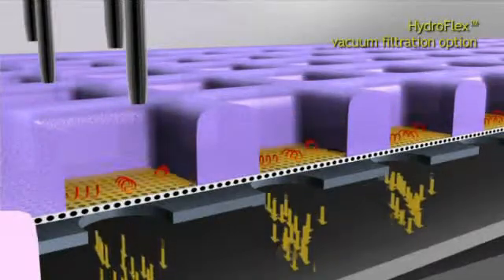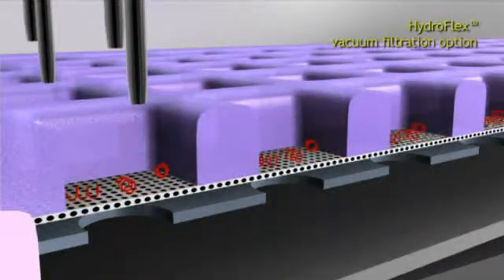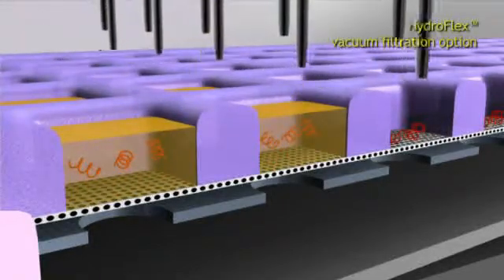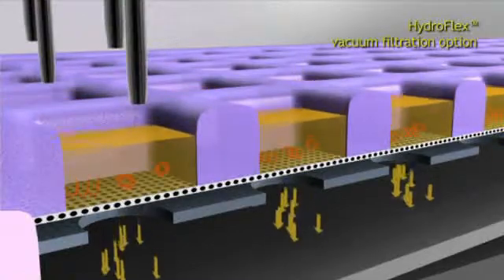The plate is self-sealing and ventilated again after the filtration step. Vacuum level is kept constant while the DNA fragments are collected on the plate's filter.